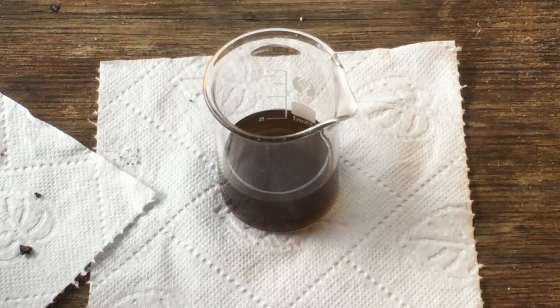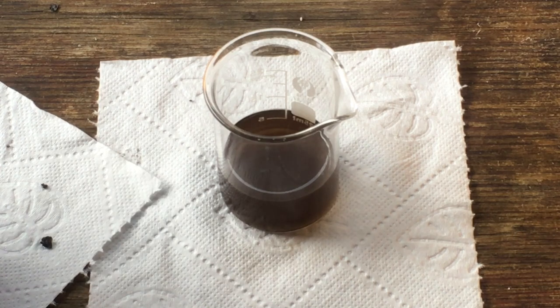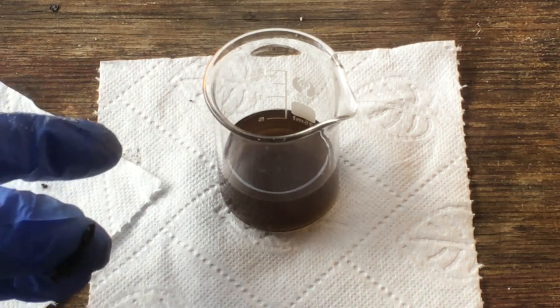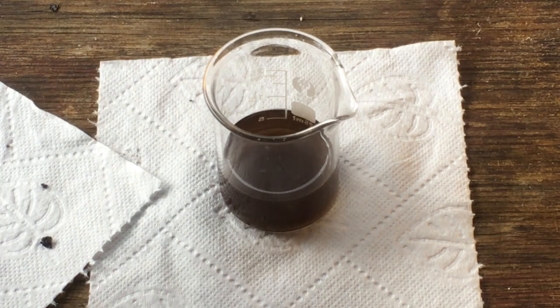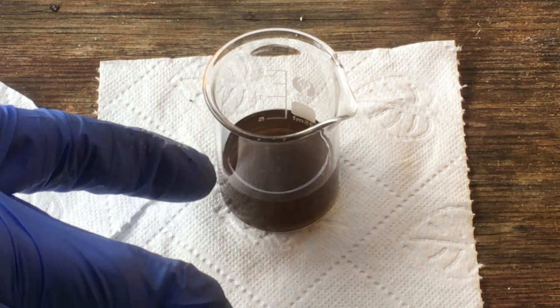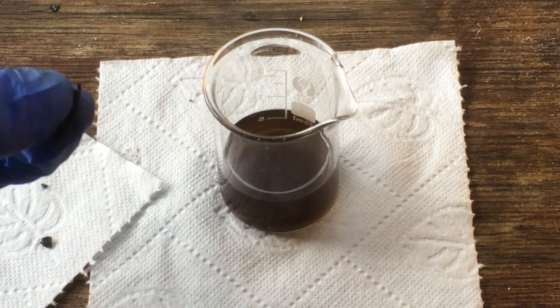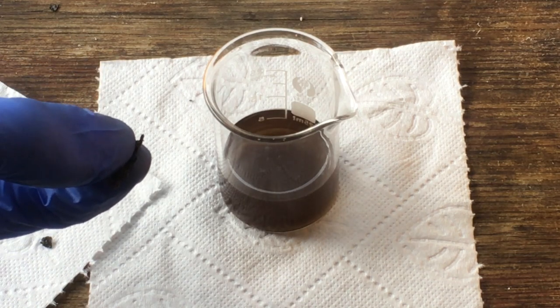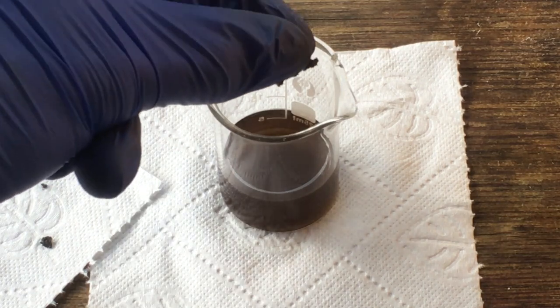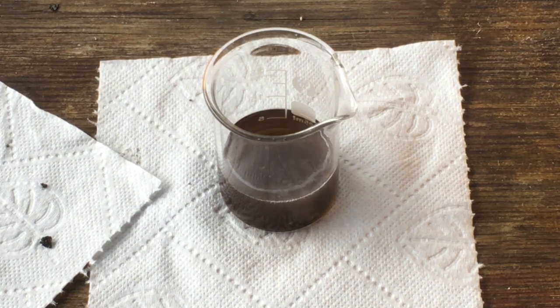As a quick test, I have some small chunks of what we think is manganese that formed on the cathode, and I have very dilute sulfuric acid in this beaker. If this is manganese metal, when we drop it in we should see it react and bubble with hydrogen gas, whereas if we've just made manganese dioxide, there should be pretty much no reaction. Dropping it in — we definitely get a reaction there. Excellent, we do have what can only be manganese metal.